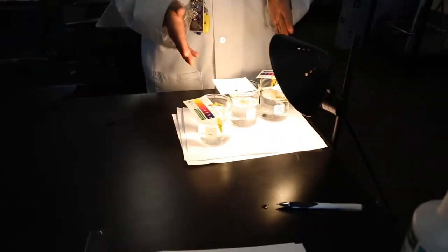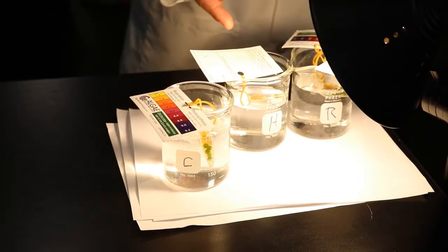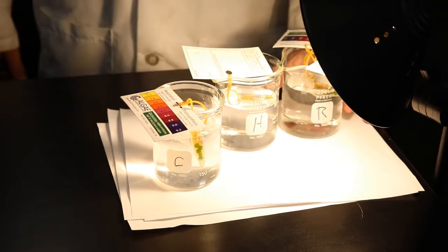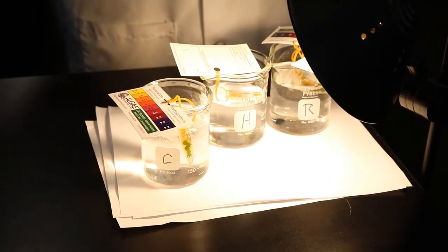Okay, Lions. All right, Coach Looney here. Now I'm going to lead us through this lab, and Mr. David's going to help record the data. So, in front of us, Lab 14, we have 3 beakers. First beaker being our cold water, and our algae's resting in there. Second beaker being our hot water. And our third beaker is our room temperature water. Now all 3 of them are exposed to the light equally, and we're going to record the first 10 minutes.